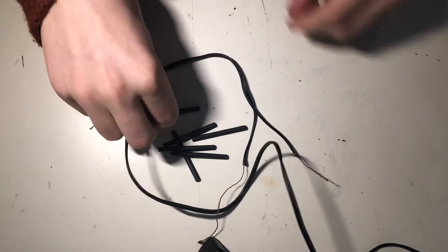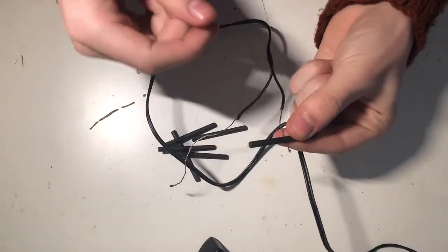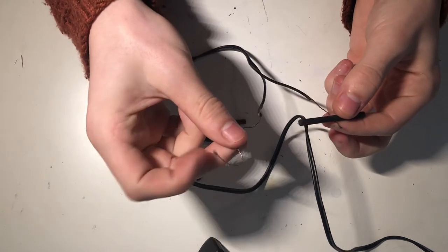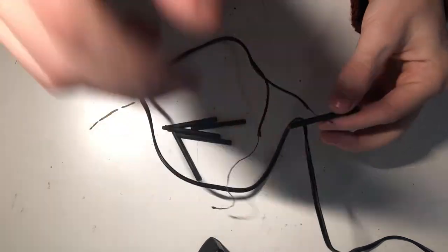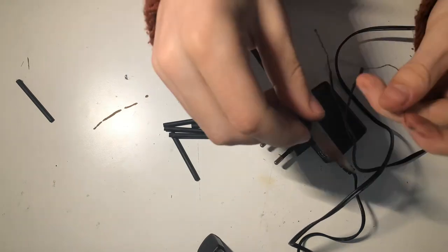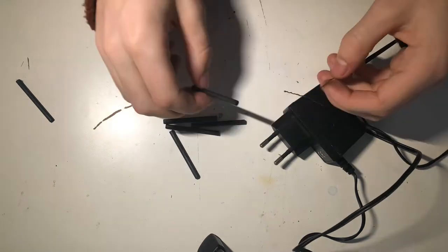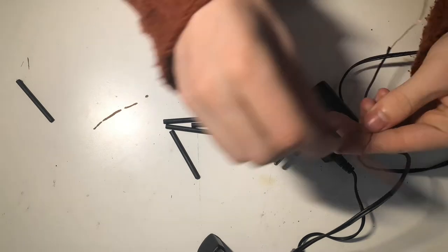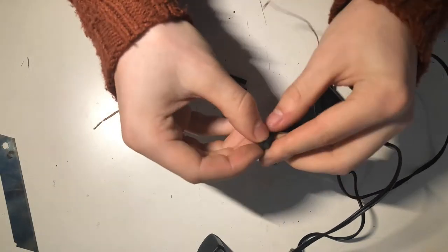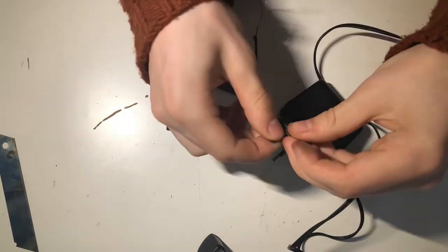What I did is I just taped on some graphite electrodes that I got from carbon-zinc batteries. You can get those batteries quite cheap, but those carbon electrodes aren't ideal because they erode quite quickly. So it's better to use MMO or platinum, but that's really expensive. So I just taped those electrodes to the copper wire.